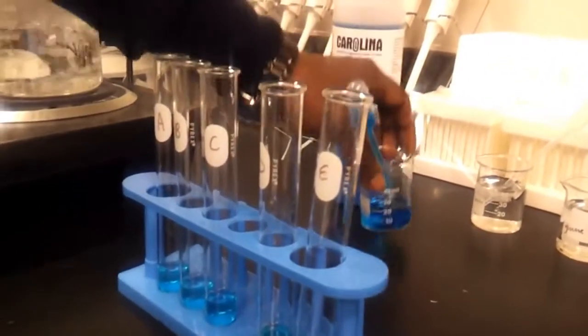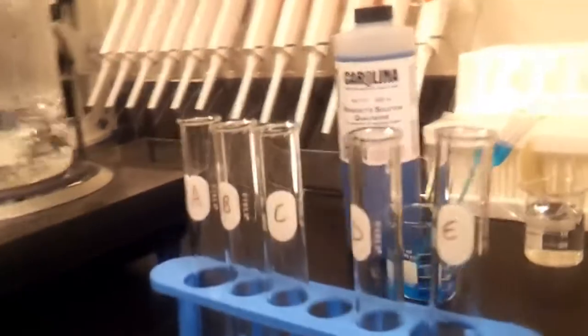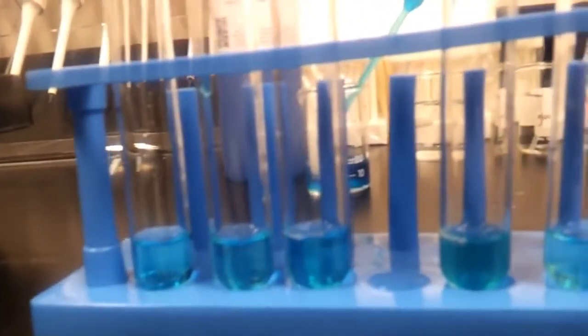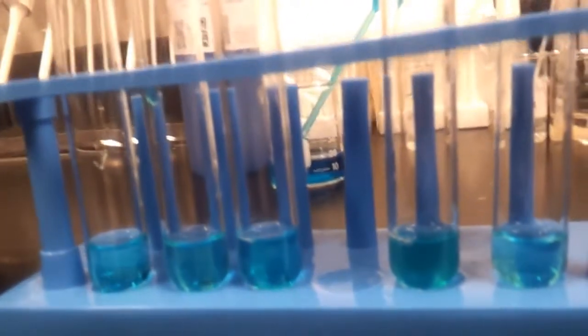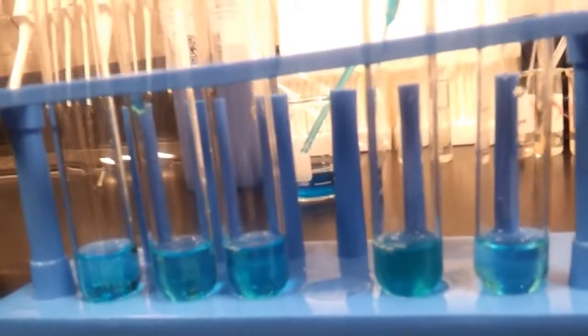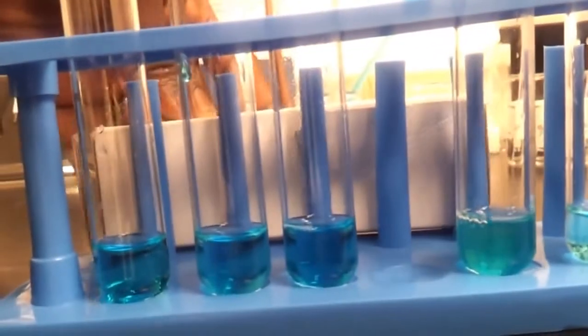Now, I'd like for you guys to pay attention to the colors that each of them appear beforehand. Now, I know that our background is blue, so it makes it a little hard to see, but what I can do is I will put a white backdrop against it so maybe you can see it a little bit better. So, you can see that they're all that nice blue color.